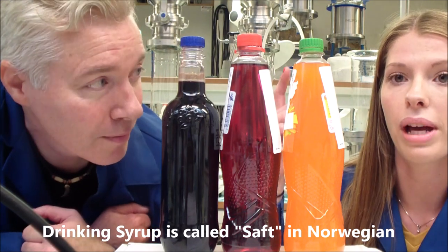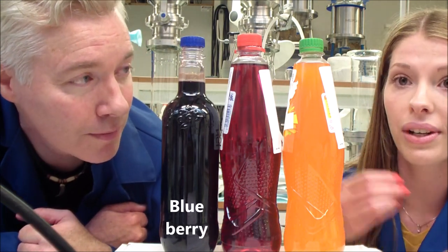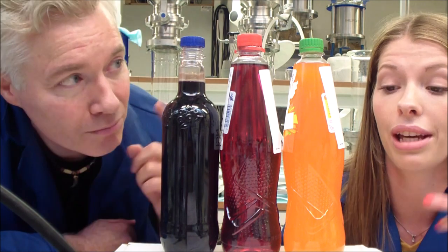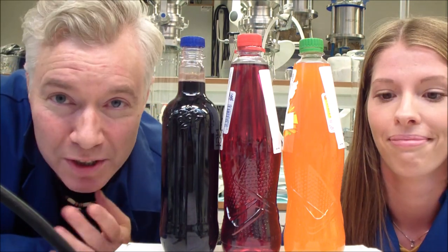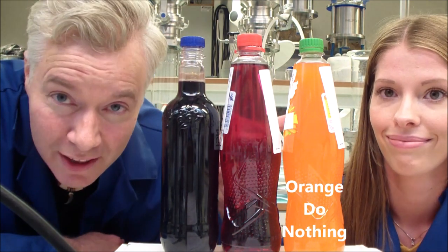Here we have three different flavors: orange, fruit mix, and blueberry. We don't think the flavor should have anything to say about the amount of plastic, but we're more interested in plastic from the cork and from the bottle.